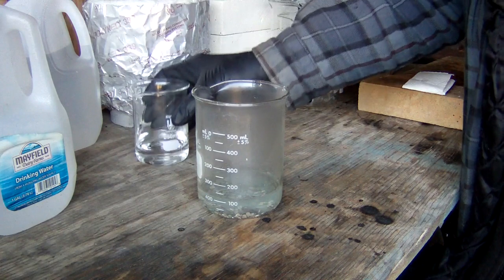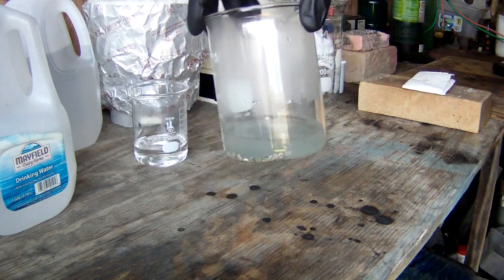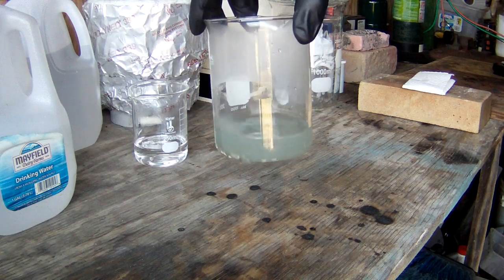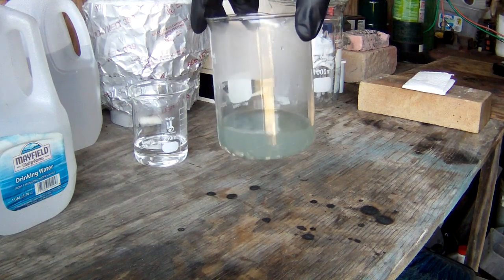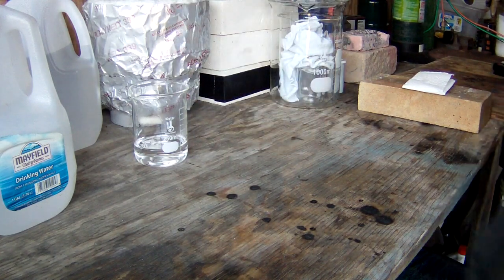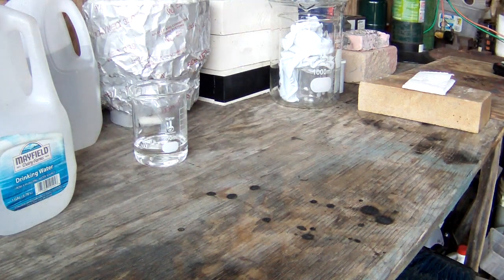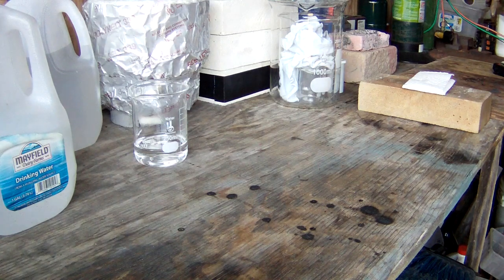Put in about 25 mils of nitric. We're getting a pretty much instant reaction like I thought we would. So I'm going to go ahead and set this in front of the little blower fan out here, and we'll just let her go. We'll get back at you in a little bit.